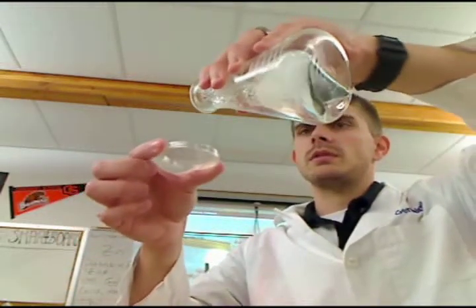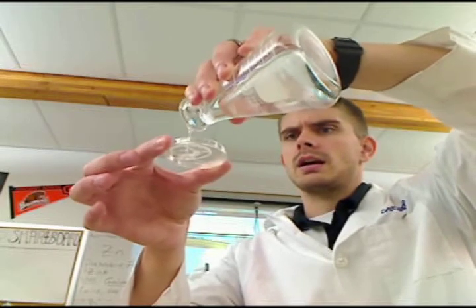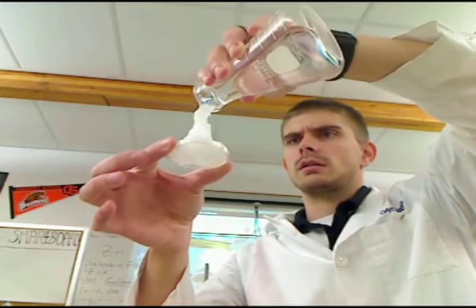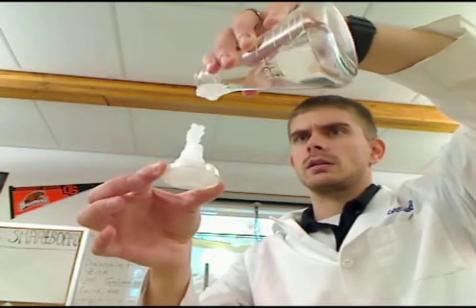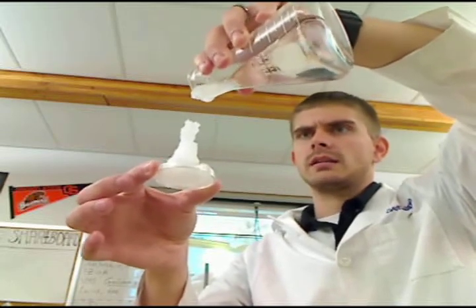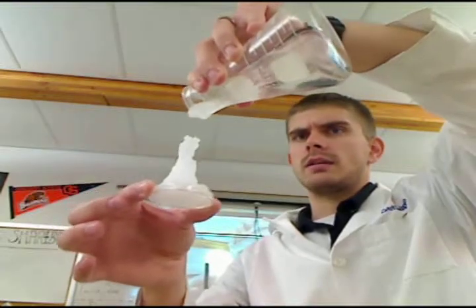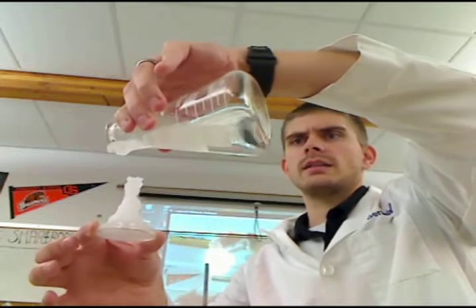I'm just gonna pour this clear liquid out. That's pretty smooth. Oh, touch it. I am touching it, unfortunately. And it is currently working its way down the bottle. You see the white solidifying down the bottle?